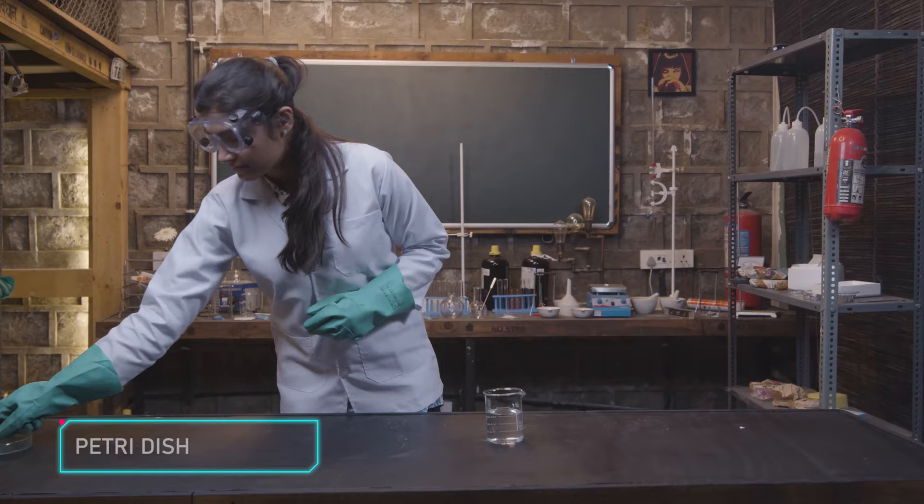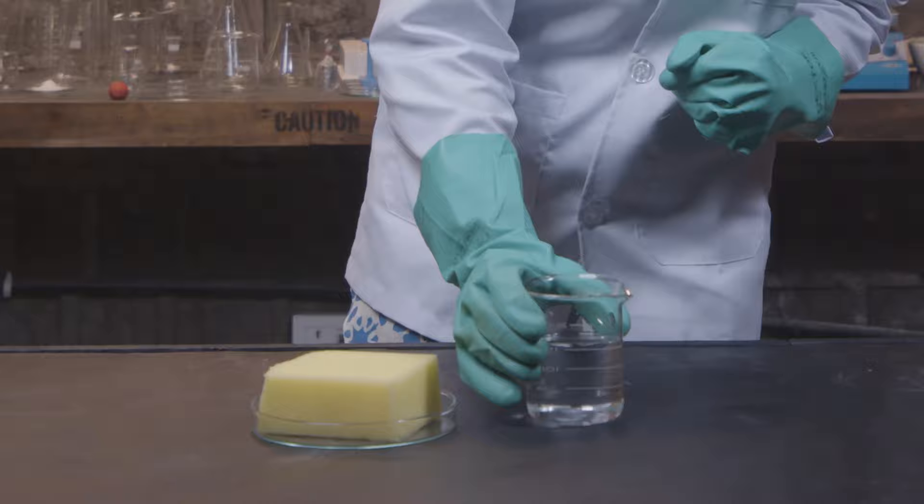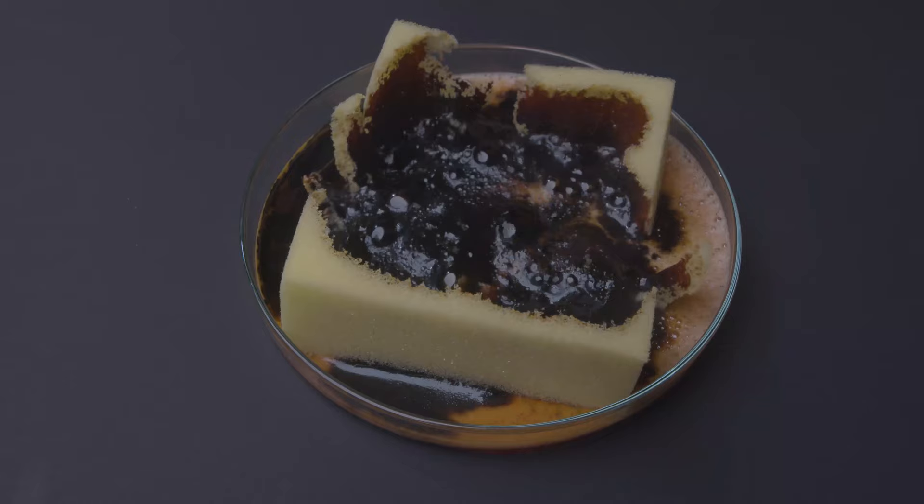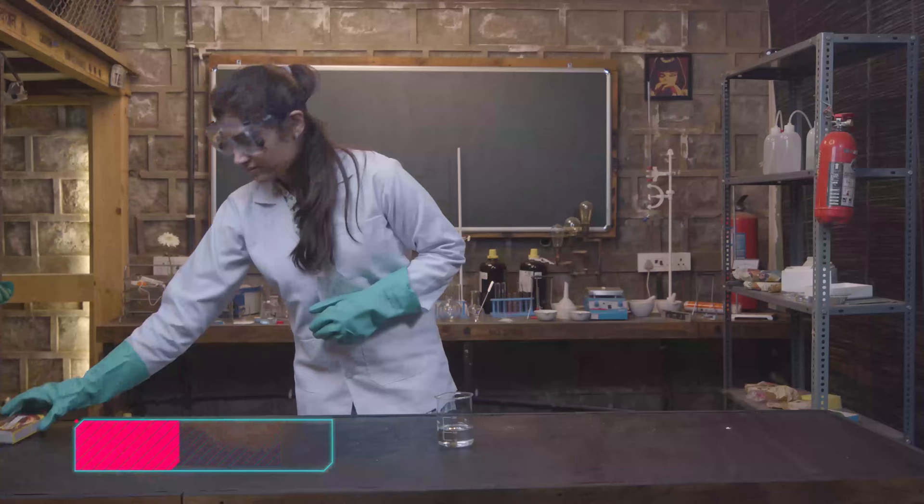Well now, let's try the same with a sponge. Take your petri dish and place a sponge in it. Take a beaker of sulfuric acid and slowly pour it onto the sponge. Slowly guys. As you pour more acid, the sponge continues to disintegrate.